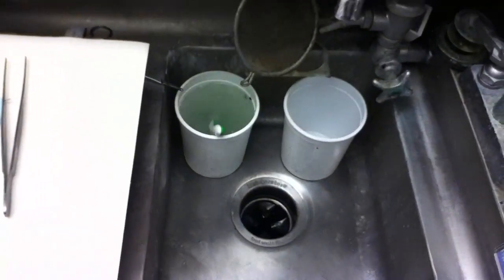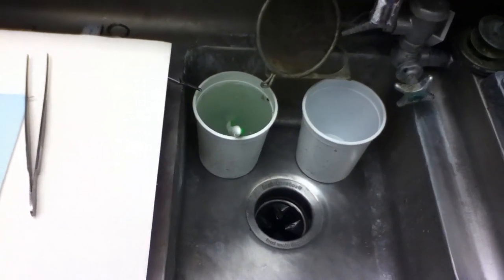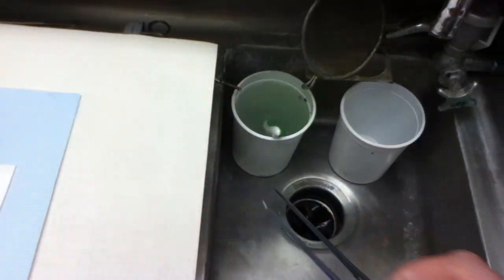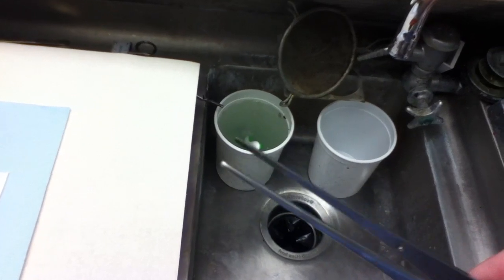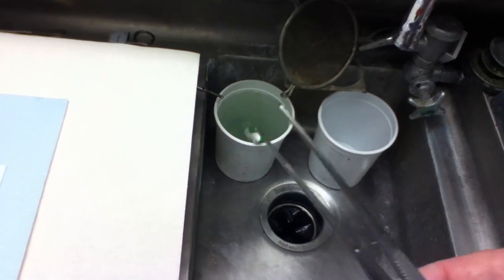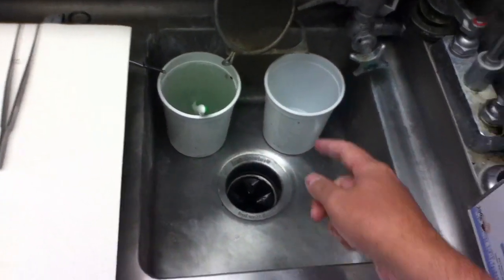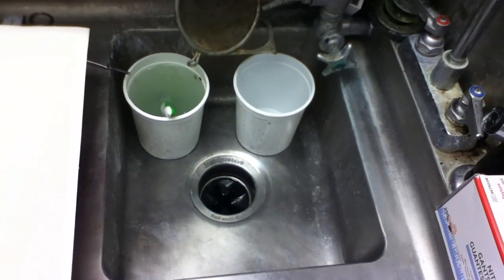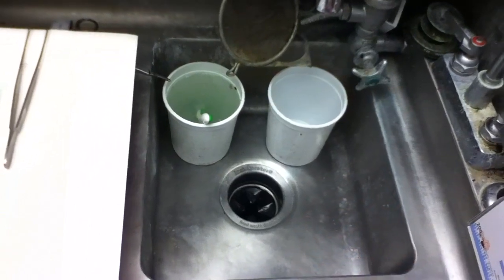In the sink I have a bucket of soapy water with detergent and an old toothbrush I repurposed for cleaning out the grooves on forceps. Watch out for stuff trapped in there — use the toothbrush to get it out because you can get cross-contamination easily. The other bucket is where I pour excess formalin so I can recycle or neutralize it and it's not going down the sink.